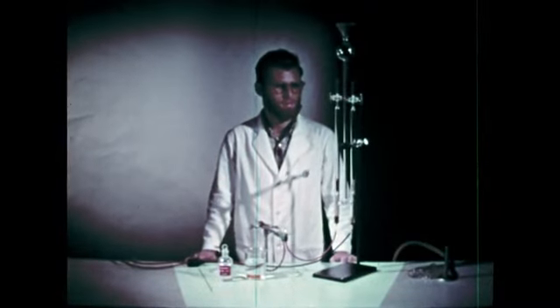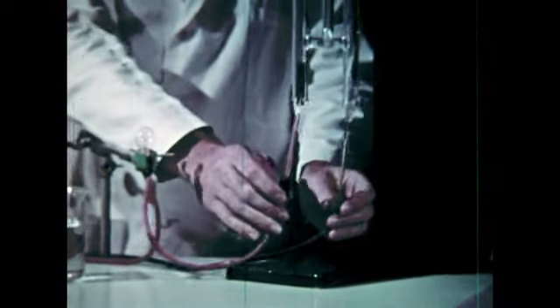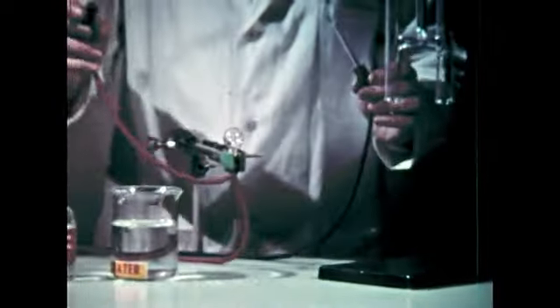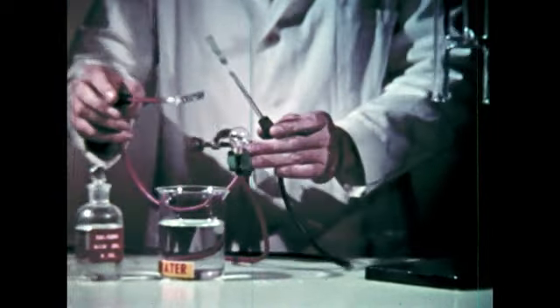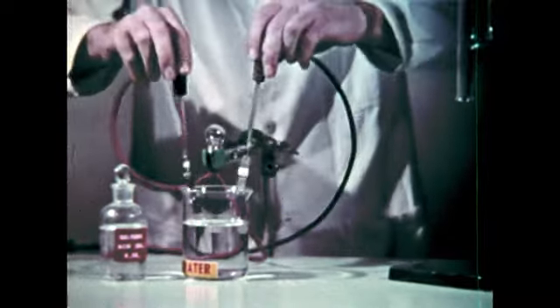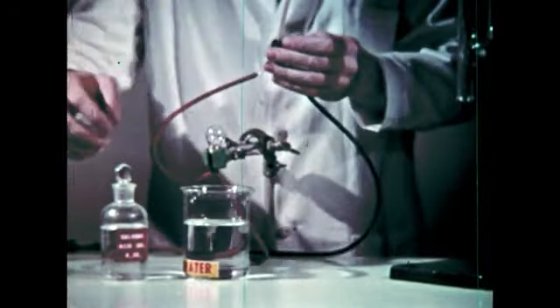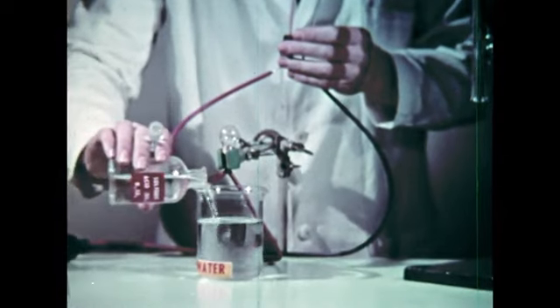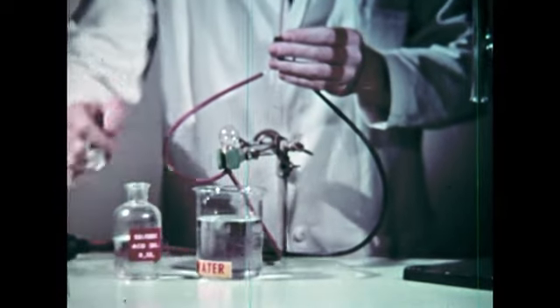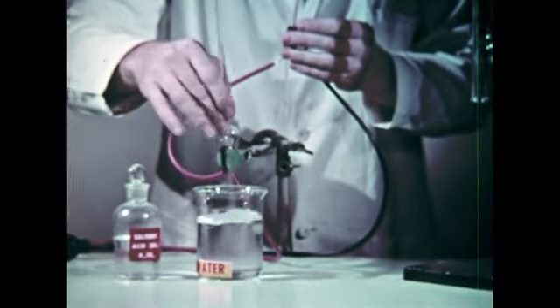The separation of oxygen through electrolysis of water is also a common industrial method. Two electrodes are used to pass an electric current, as shown by the light. However, distilled water does not pass a current, so we have to add an electrolyte, sulfuric acid in this case. The electrolyte provides ions which can move and allow the current to flow.